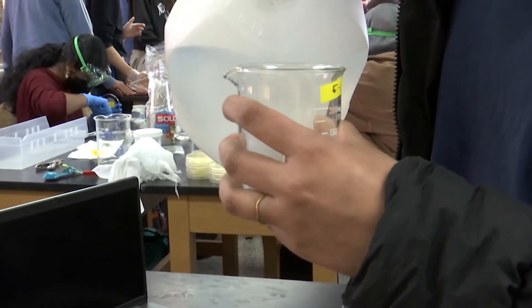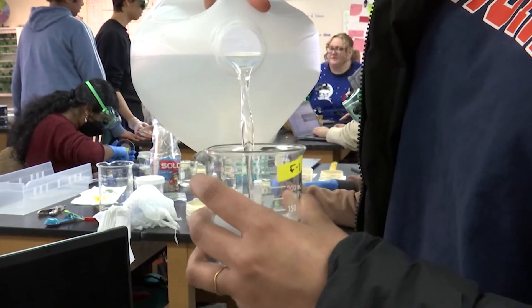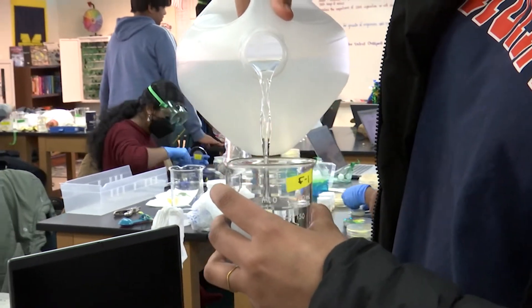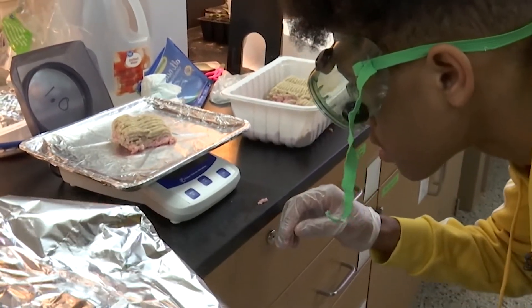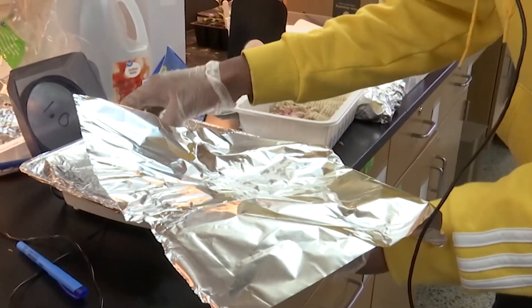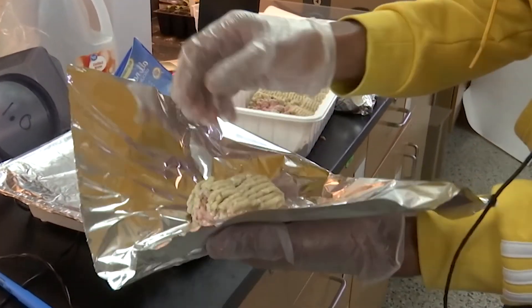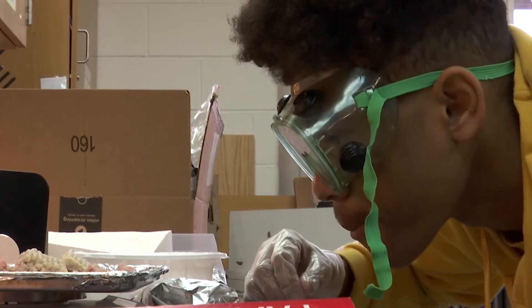I've heard that vinegar erodes teeth, so that's what I'm going to check for. Part of their assessment is the personal significance and personal engagement with the research question. We have students who are doing calorimetry, but they are doing it on the different amounts of fat content in turkey, to figure out how many calories are in there and how fat content affects that fluctuation.